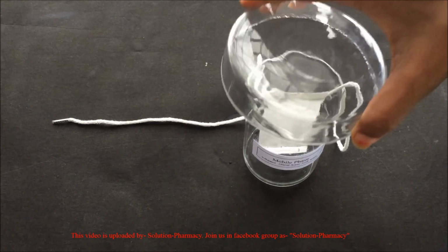Paper chromatography is based on the principle of partition. Here the components of the mixture partition between two liquid phases. One is the stationary phase, which is the water held in the pores of the filter paper, and the second is the mobile phase. The components in the mixture get separated due to the difference in the affinity of the components towards the stationary phase and the mobile phase.